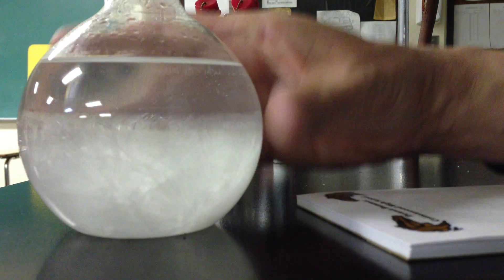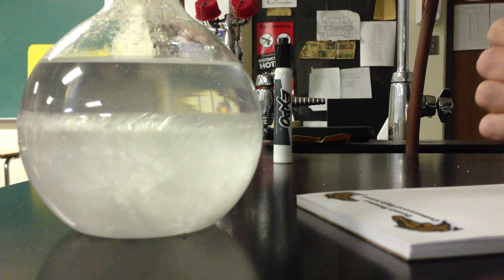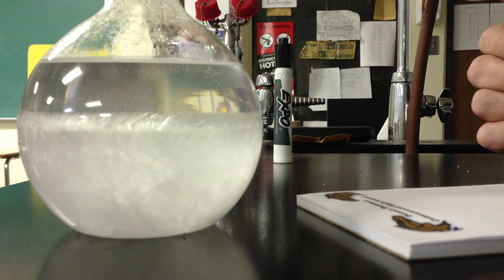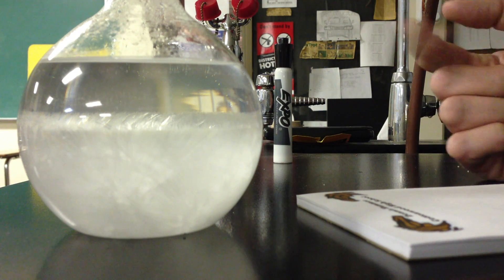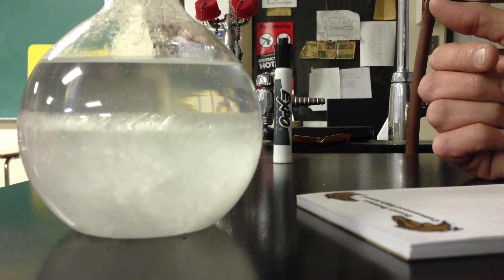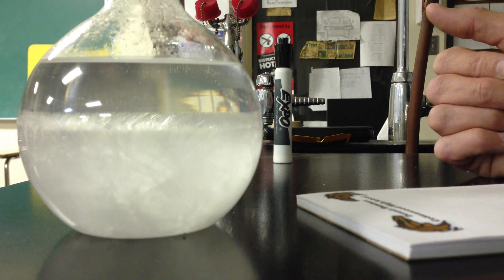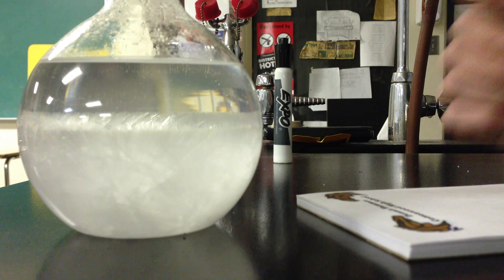And so this is actually quite warm. And they actually make portable hot packs with this stuff right now. In fact, I saw it at the store this past weekend. They were selling some. And you can regenerate these. All I need to do is throw this back on a hot plate and heat it back up, get it all to go into solution. And then I cool it back slowly to room temperature. And I've got myself a supersaturated solution once more. Sort of kind of cool, isn't it?